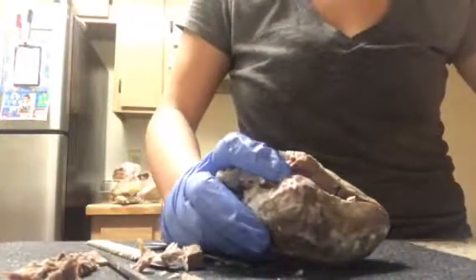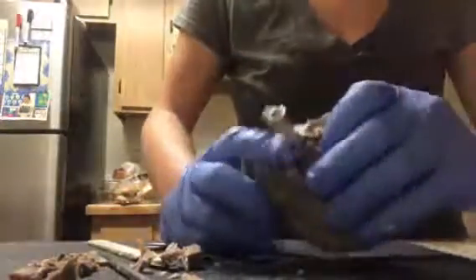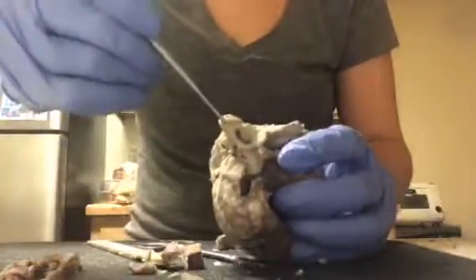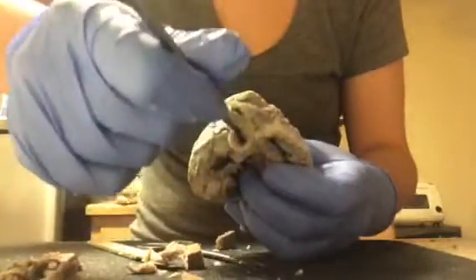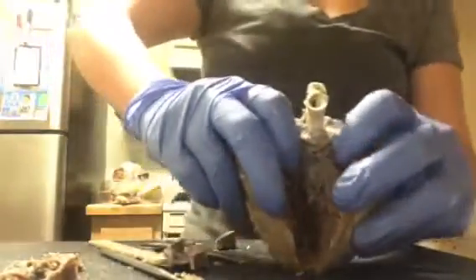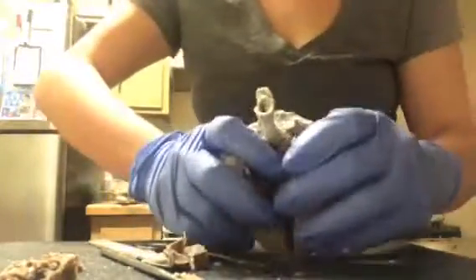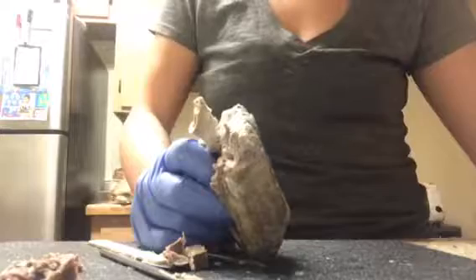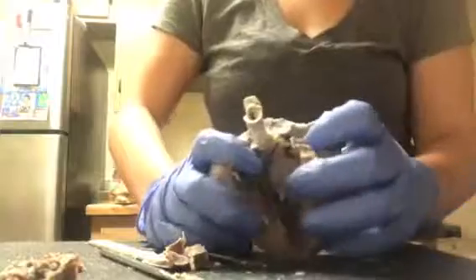Okay. So moving along, let me just get another view. So basically what I have learned is that the aorta is going to be right down here, and there is a little hole, and this leads down into the heart. By that, the pulmonary artery and the arteries after that are going to pump the blood, which will then go throughout the body. With that being said, oxygen levels will be throughout the body, allowing us to live.